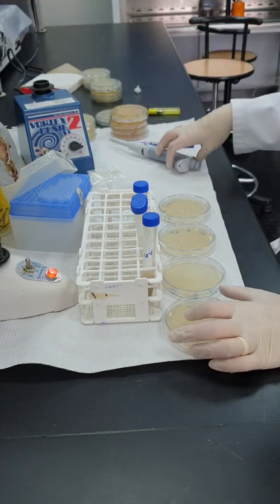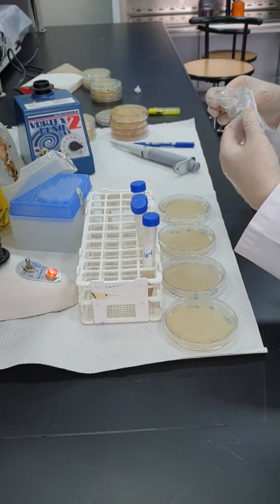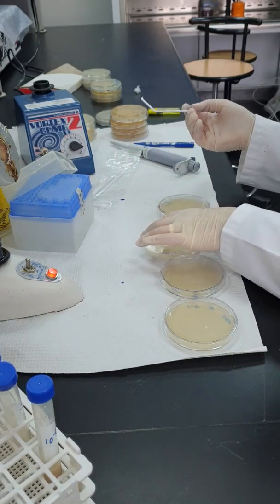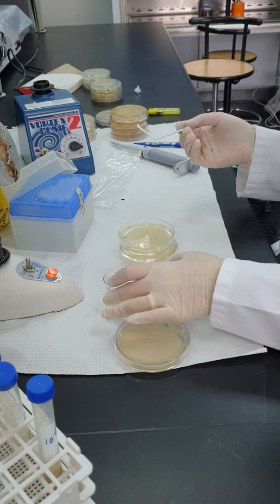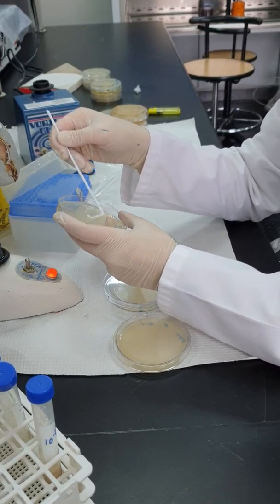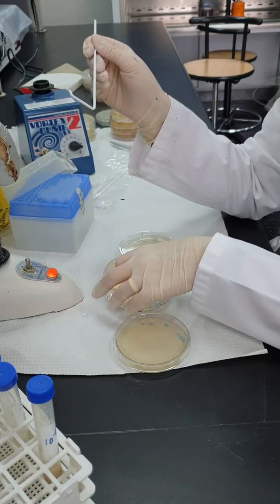In this step, you need to be fast. We want to spread the liquid on the Petri dishes. I will take a sterile plastic spreader. In research labs, they use glass spreaders that are reusable. You can sterilize them with heat and alcohol. So I will take my first Petri dish. I am turning the Petri dish in my hand anti-clockwise, and the spreader on the Petri dish clockwise. I keep on doing this until I see the liquid totally distributed and dry on the Petri dish. This is my first Petri dish.